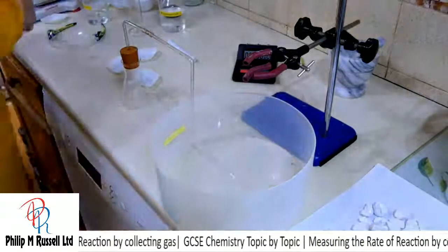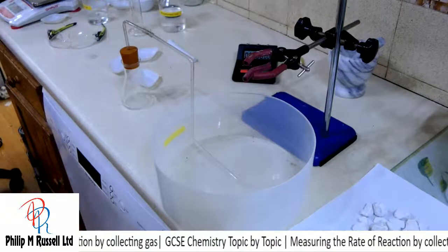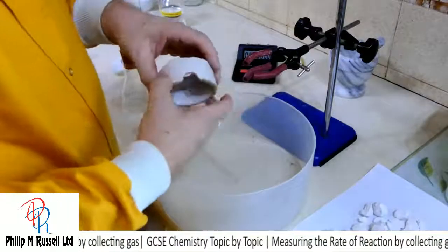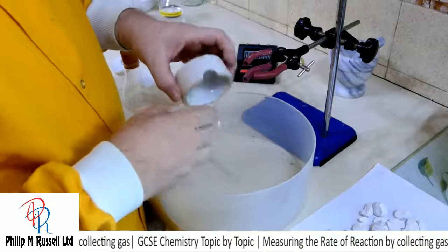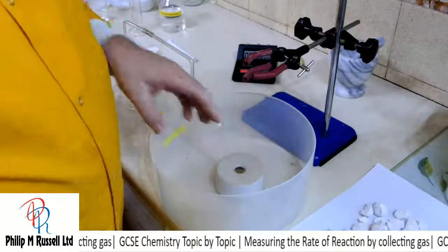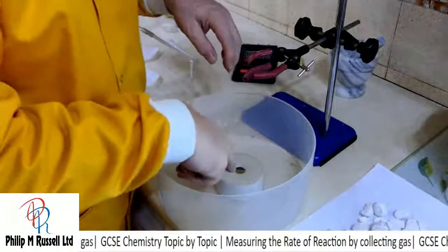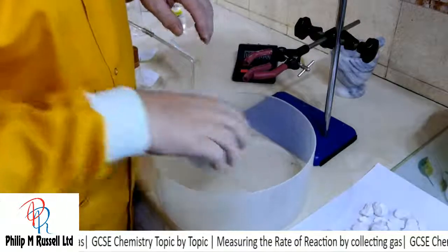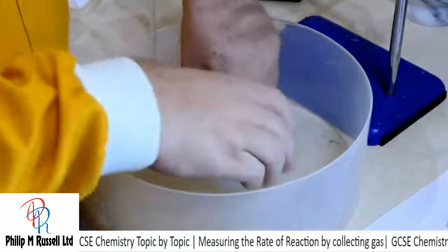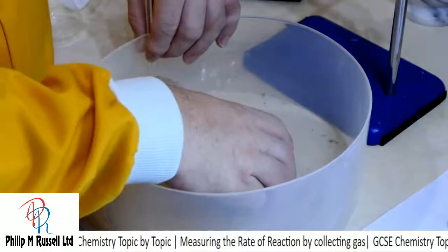And I forgot the beehive shelf. Fortunately for me, one arrived, and here is a beehive shelf. So cool because it's got this little hole here that fits over that tube, and what I can do is make sure that when I look down here that I can see this piece of glass tubing sticking up.